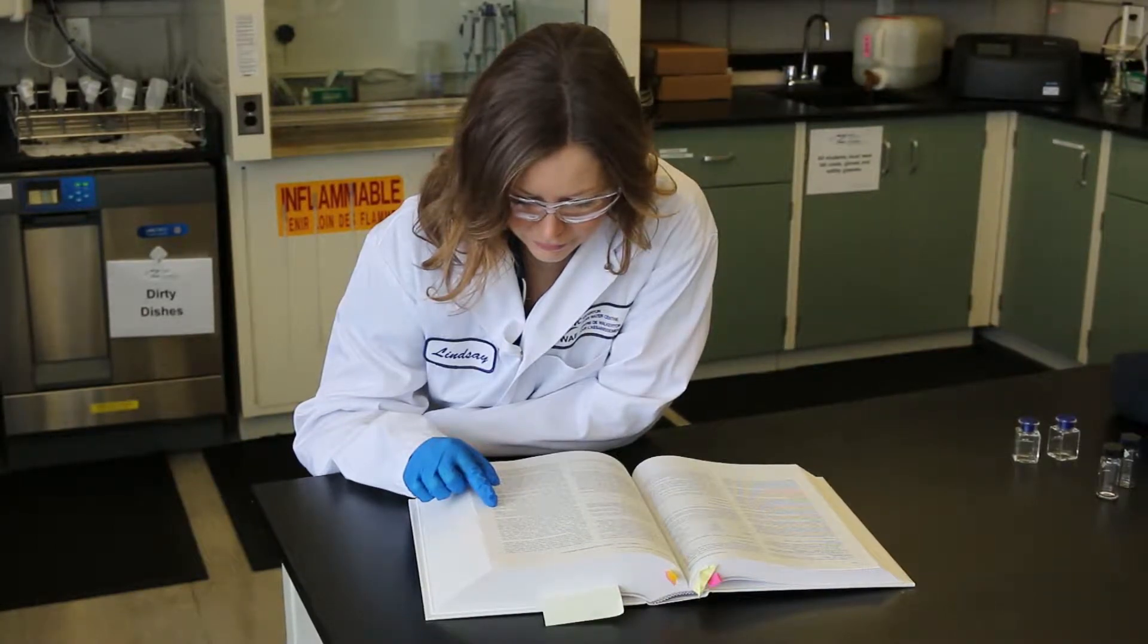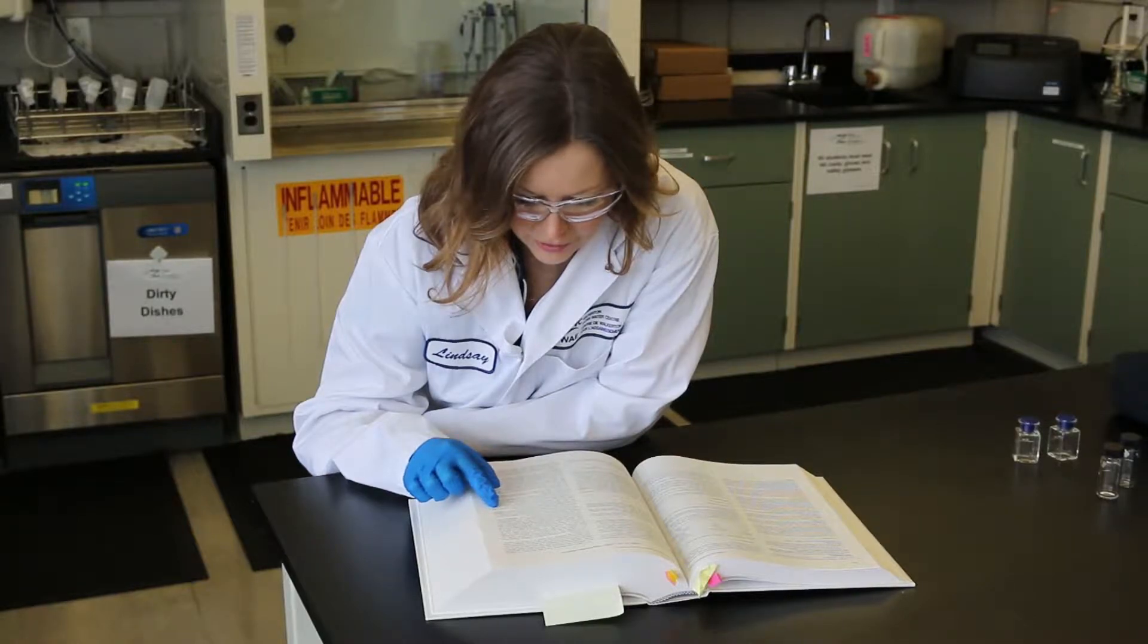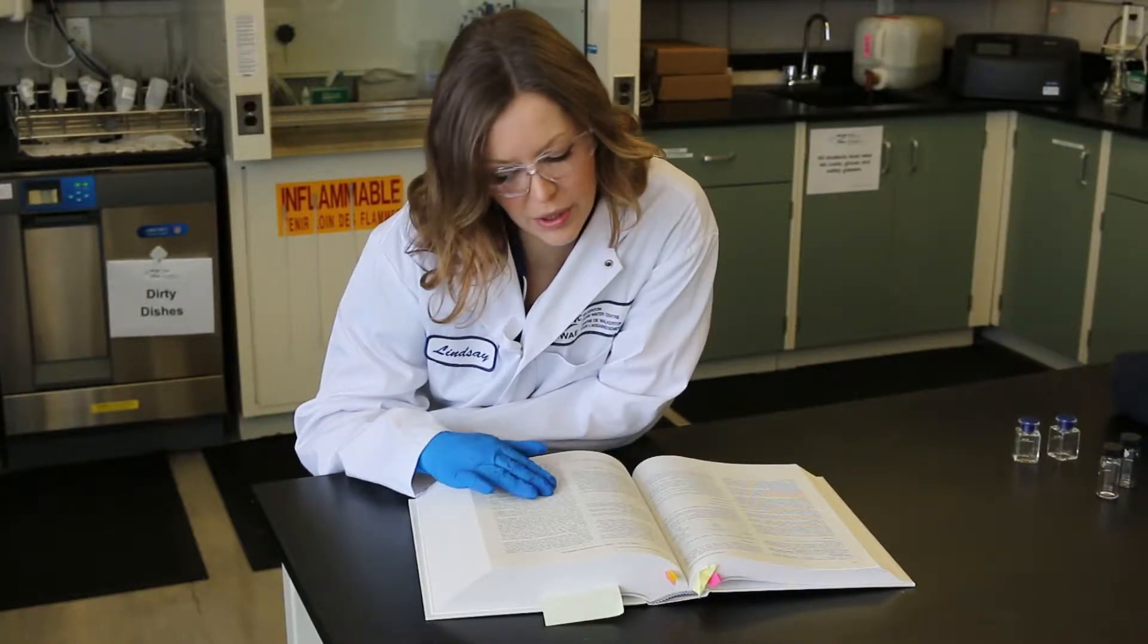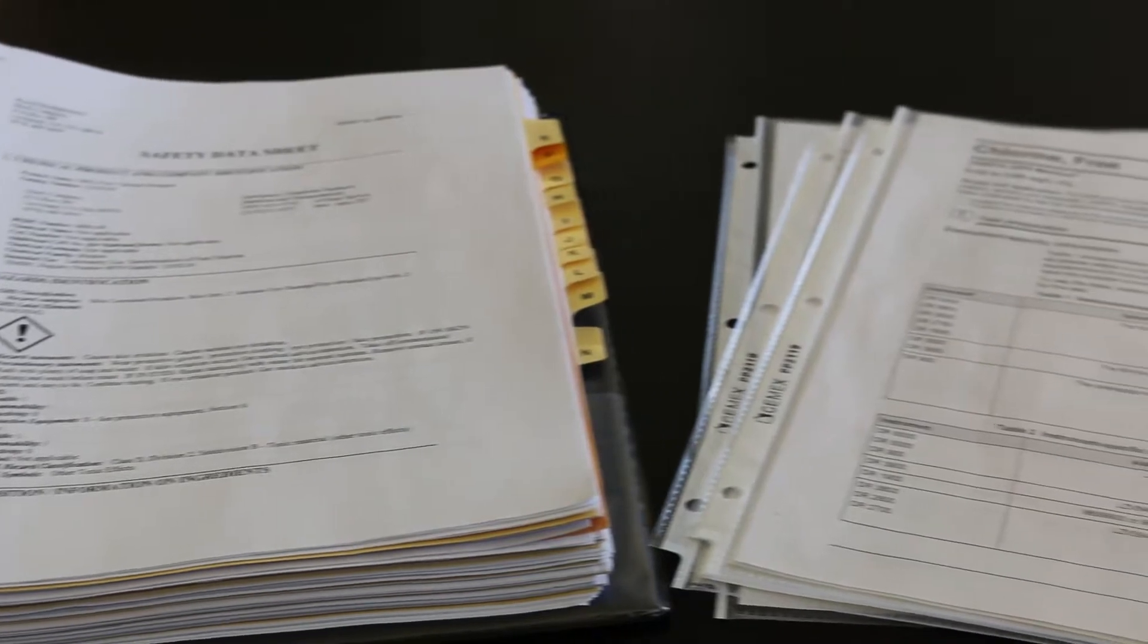This is a basic procedure overview and should not replace or overrule the instructions provided by your equipment manufacturer. You should always analyze samples according to the methods provided by the manufacturer.